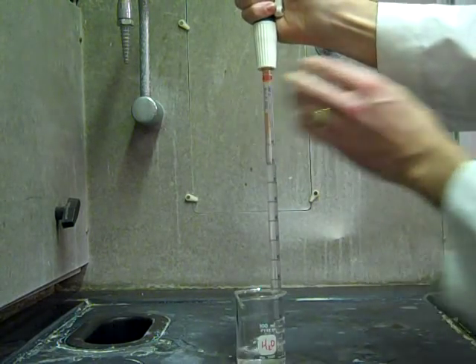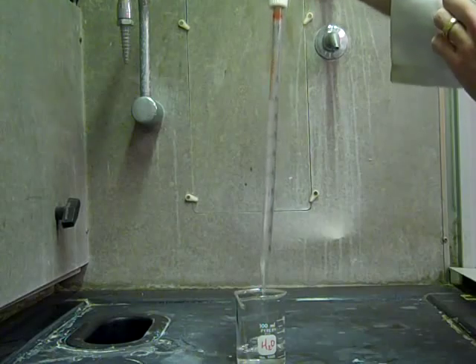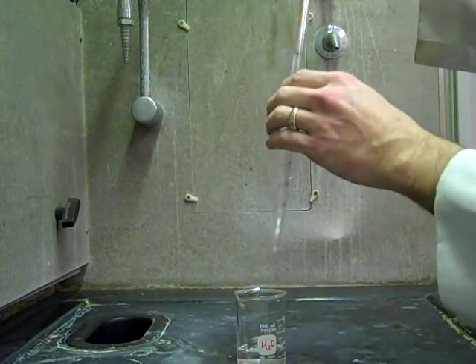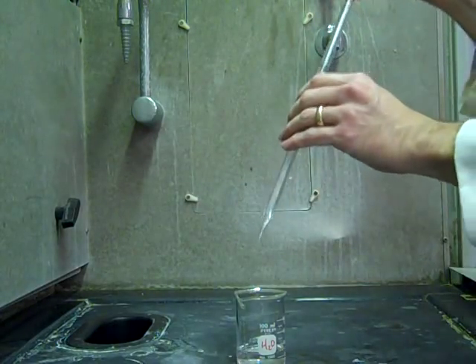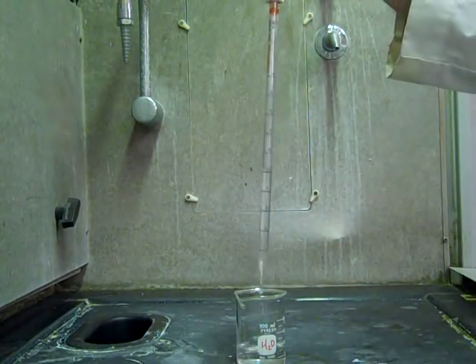So the bottom of the meniscus, that is 9. And then when you want to dispense you just have to press this button right here and it will dispense.